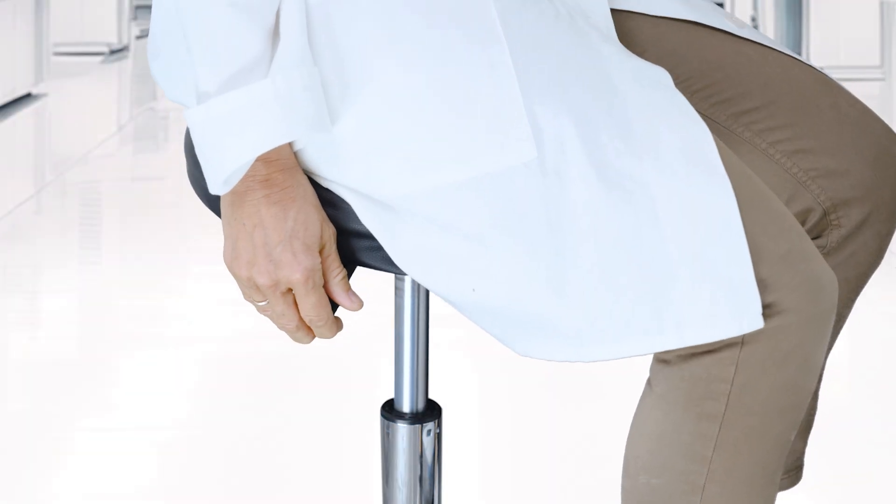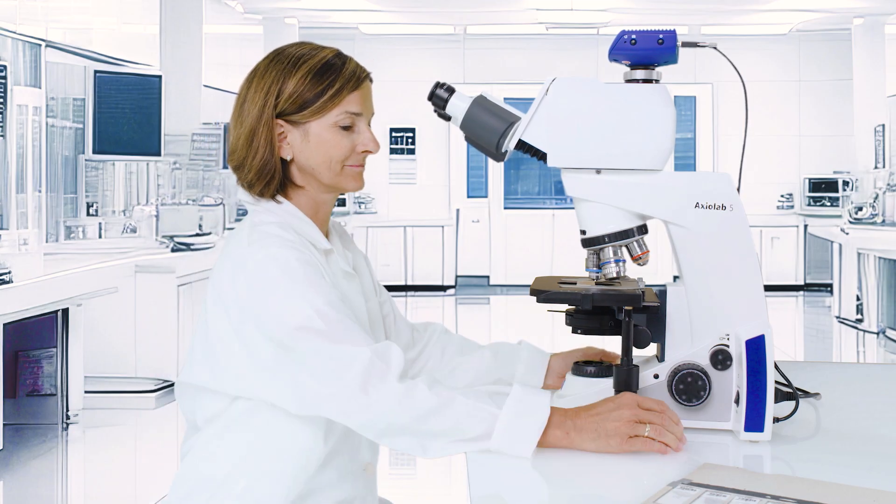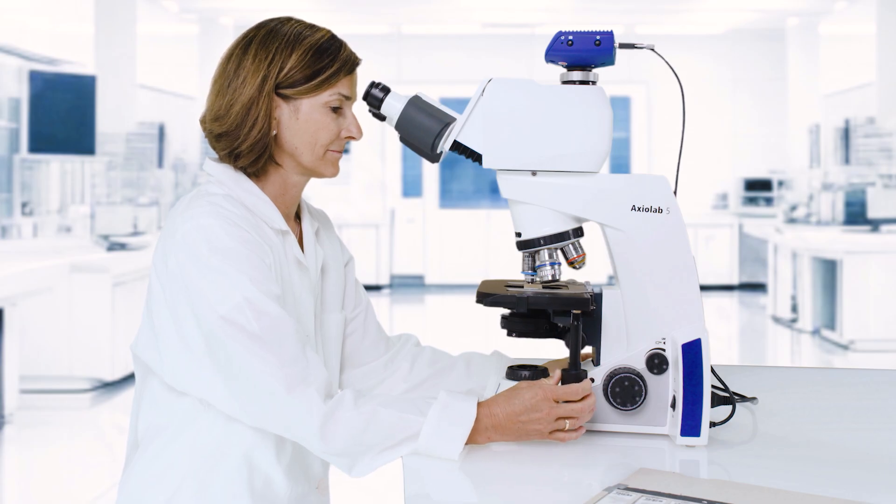First, adjust your chair height so your arms rest comfortably on the table. This ensures proper posture and reduces strain in your arms and shoulders.